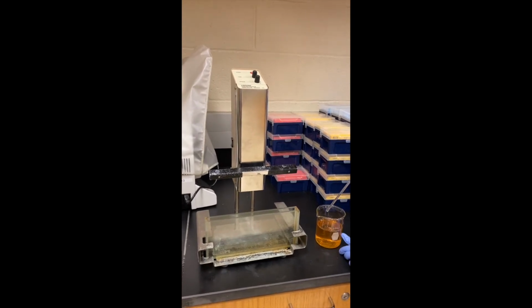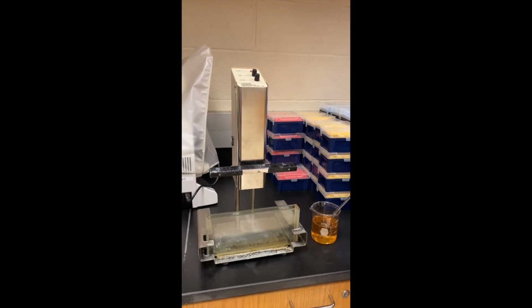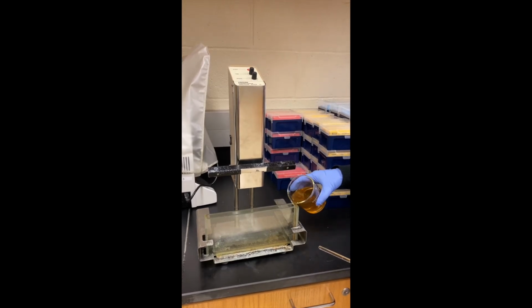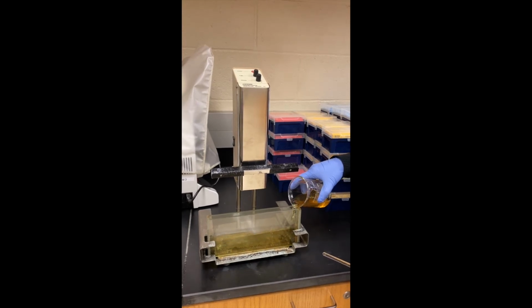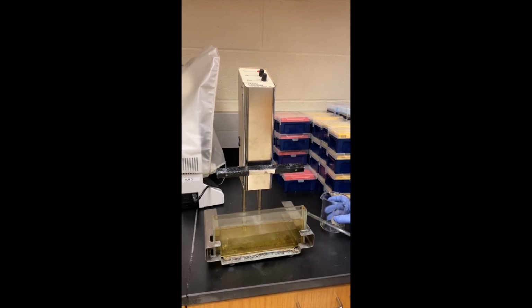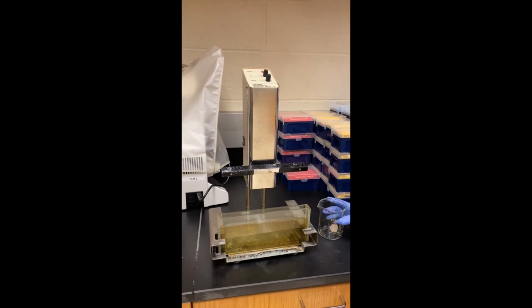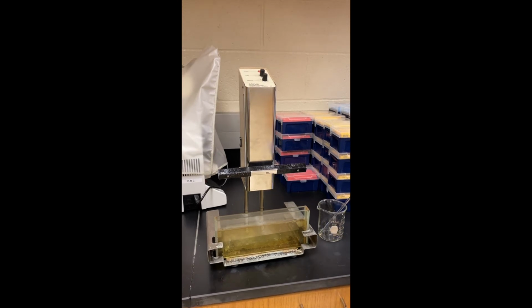This is around 150 milliliters, and this is what we will be using today. Just pour it into the chamber. This chamber can hold up to 200 milliliters, but if you make it full and then drop your plate, the solution will come up. So what I found is 150 is enough for the plate.